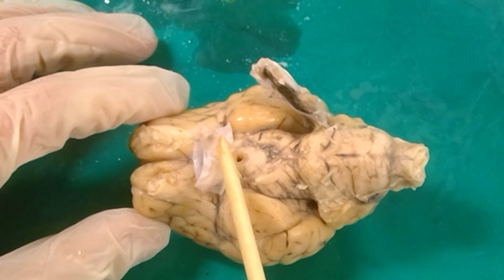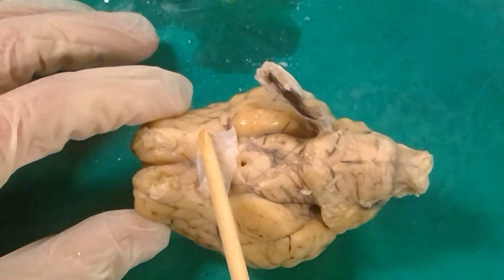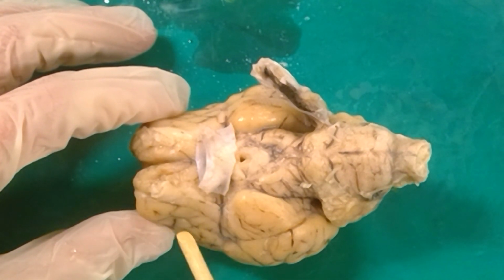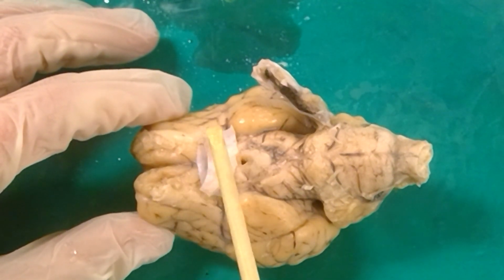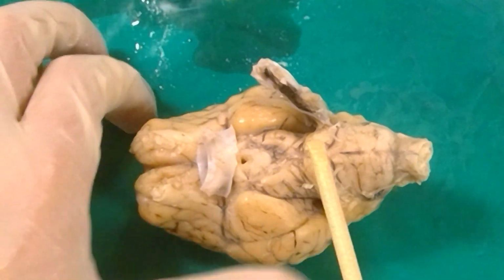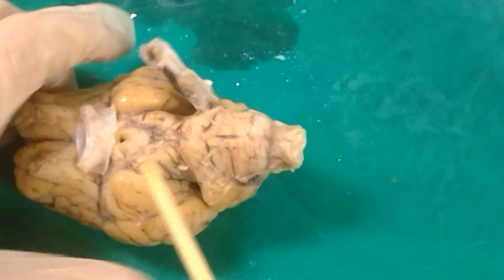Just behind that is our optic chiasm. So this is the second cranial nerve, the optic nerve. You can imagine the eyeballs are out here in space. Thank goodness they're not attached because that'd be kind of gross. But the fibers leaving the eye are known as the optic nerve. So it creates our adorable brain mustache right here.